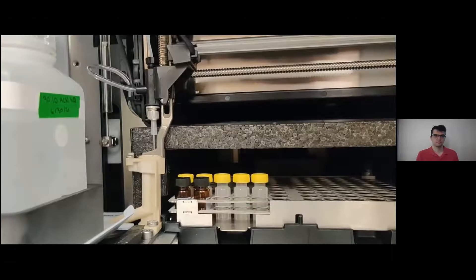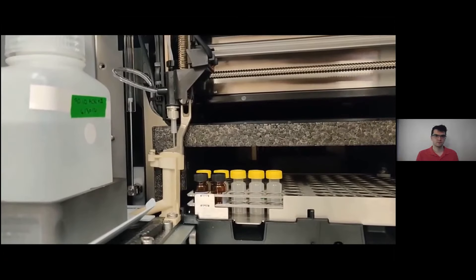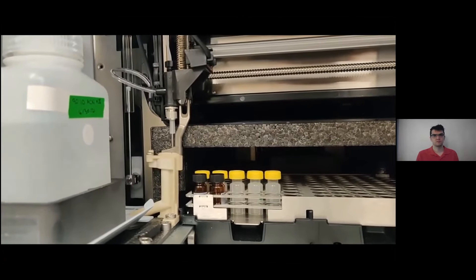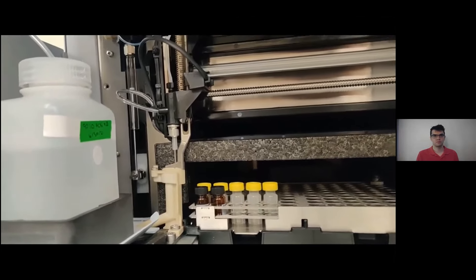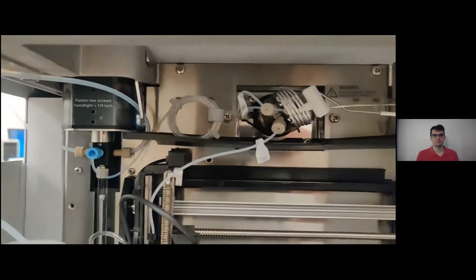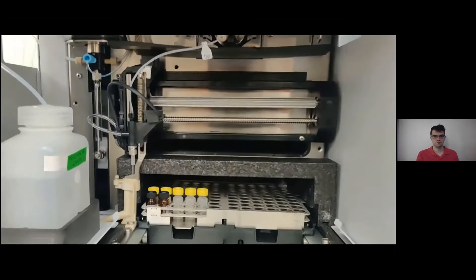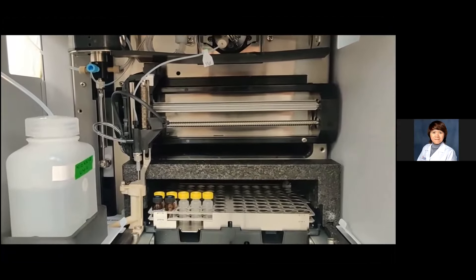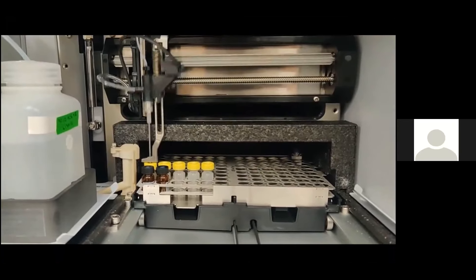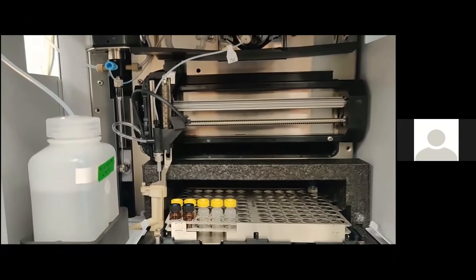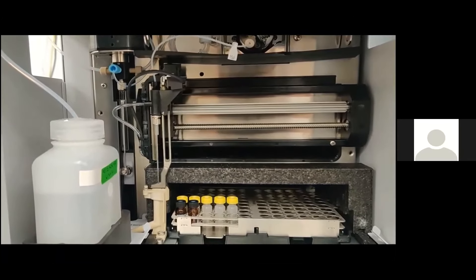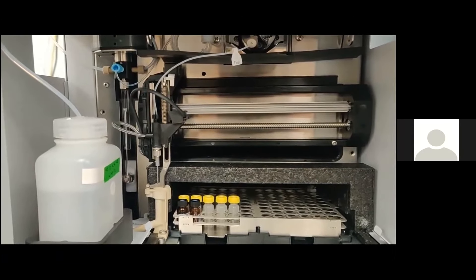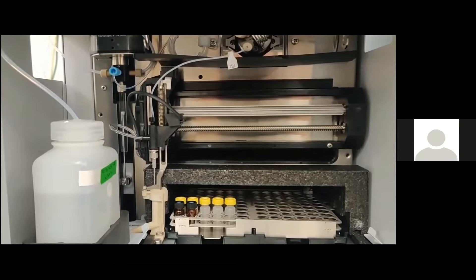This interesting little bonus clip shows the auto-sampler in action. The syringe starts by filling the loop, which it's doing right now. You can then see the needle and mobile sample tray moving in tandem to pick up the sample. The needle will then inject the sample into the loop. The sample is then carried onto the column, and now the syringe is performing its automated wash cycles.